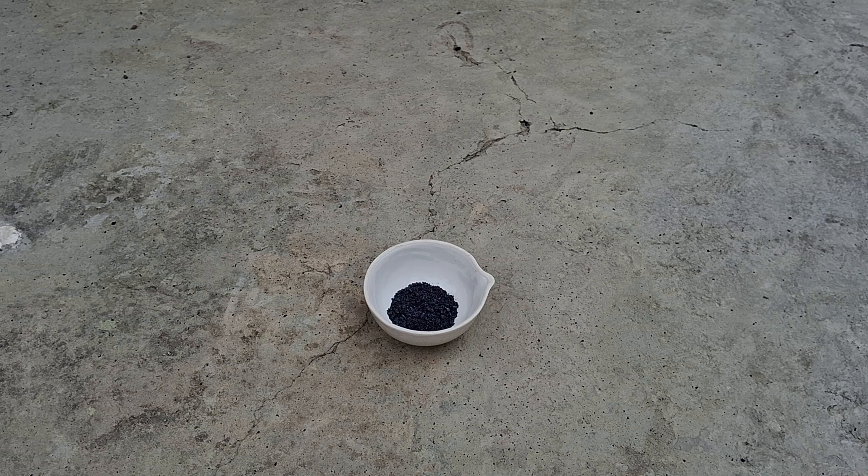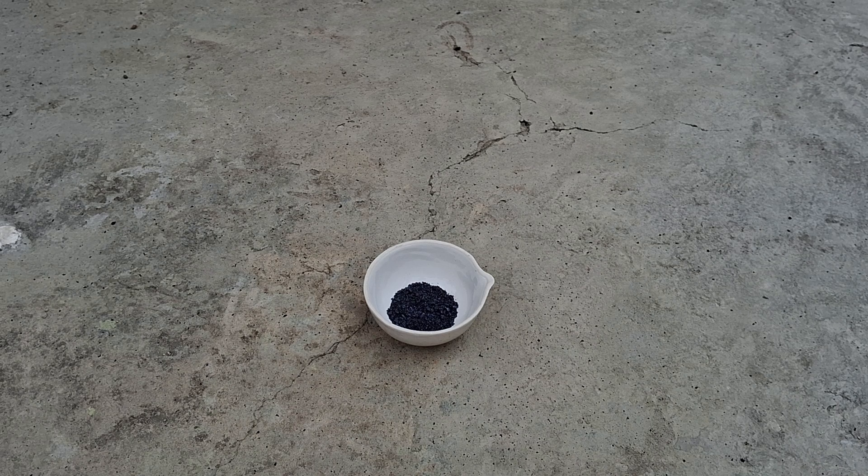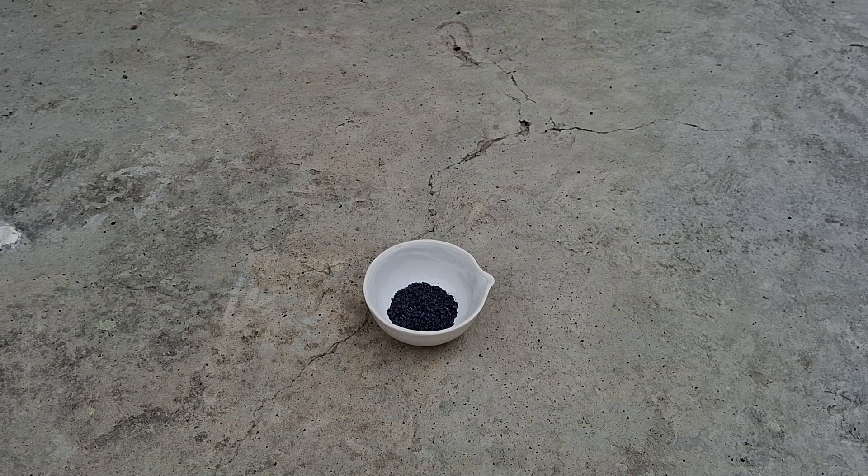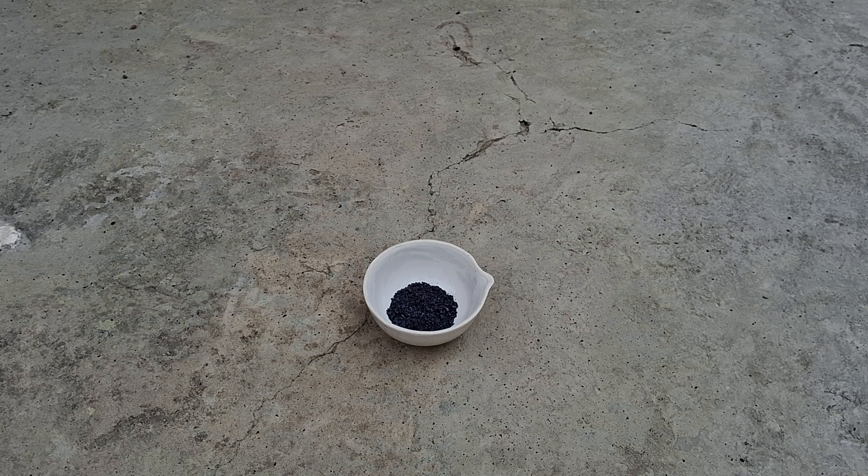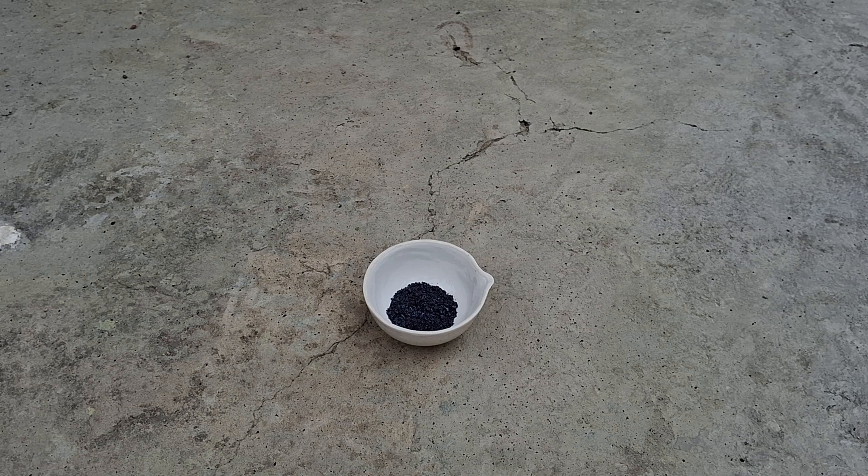The experiment itself is quite simple and straightforward. All you have to do is take a few spatulas full of potassium permanganate powder in a china dish or on a porcelain tile.